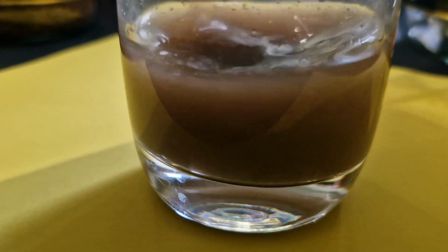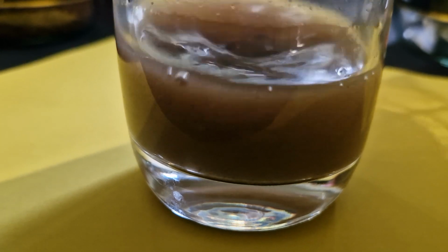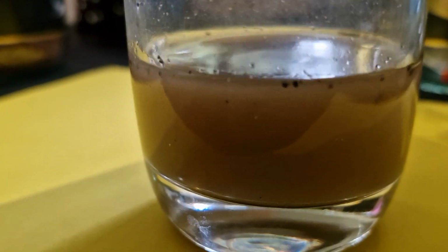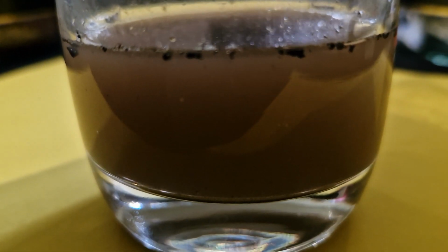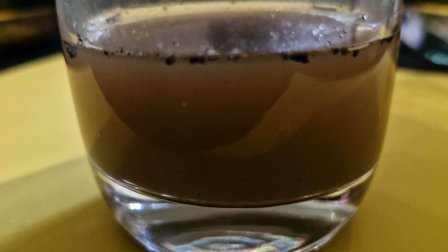So I think at this point, if we check, we can agree that probably all the sugar has dissolved, and at the bottom you're just left with the sand. So you now have this sugar solution with sand in it. So we've completed step 1. Let's now go back to step 2.